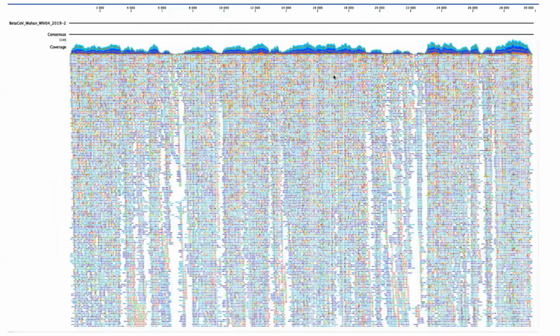Here you can see an example of sequencing from a beta coronavirus sample taken from the Wuhan Institute of Virology. And we talked about how there is this assembly of reads aligned to some reference genome, and we can analyze the reads, and we can also take a look at what kind of insight they can give us in terms of the reference genome.